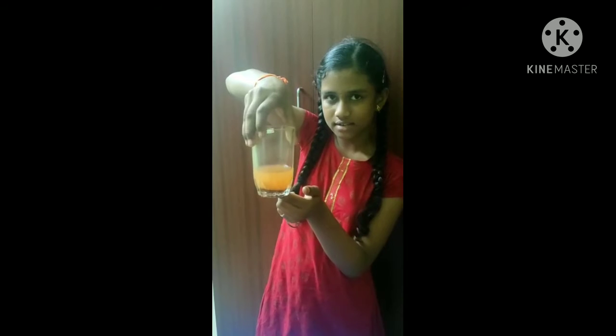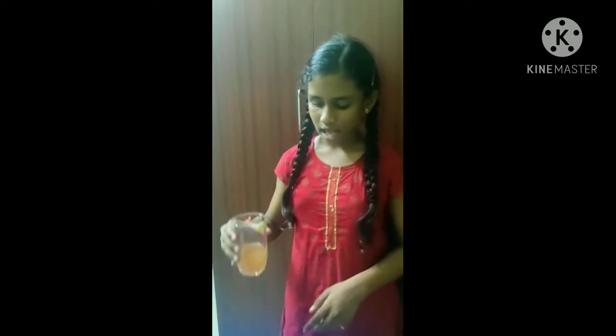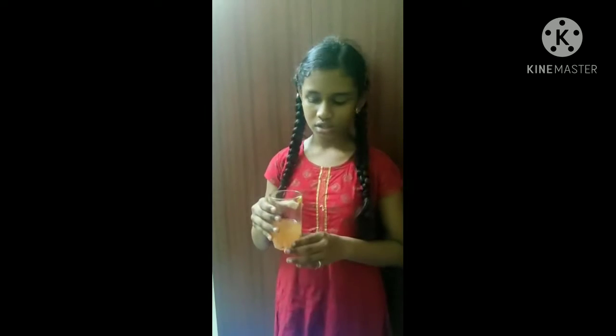This is the sand. For the next process, I have been pouring this water into this glass. This process is called decantation. However, the decantation process cannot remove invisible particles. This water also contains some invisible dust particles, so to remove them, we need to undergo filtration.